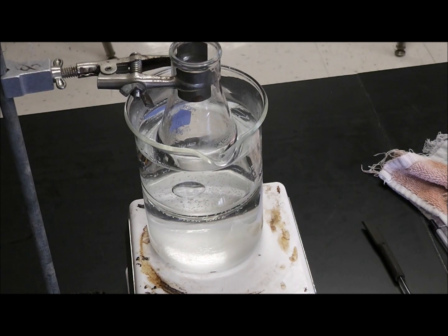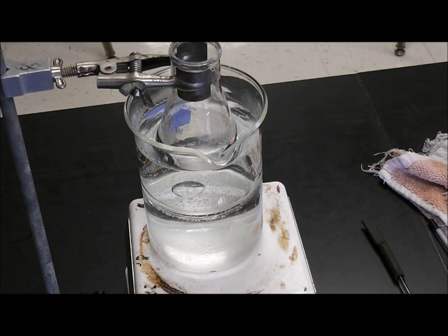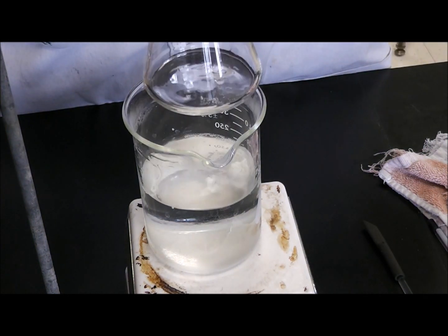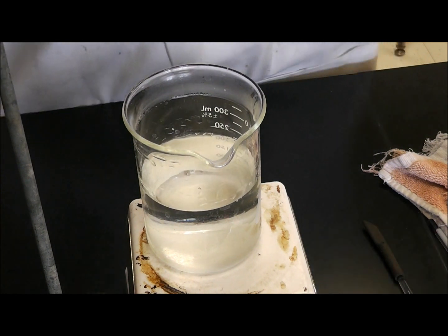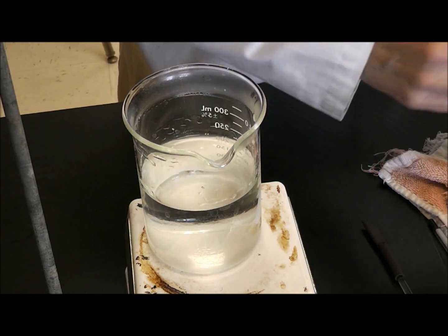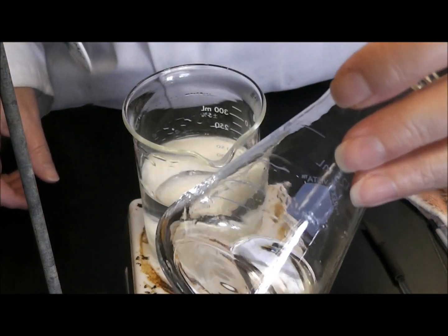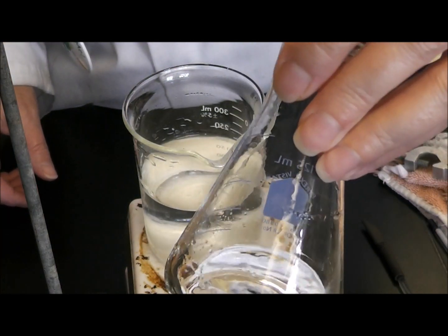All right, so 20 minutes have gone by. I am going to take my sample out of my water bath, and get it off the clamp. You will notice that while it was in the water bath it has become clear and colorless.